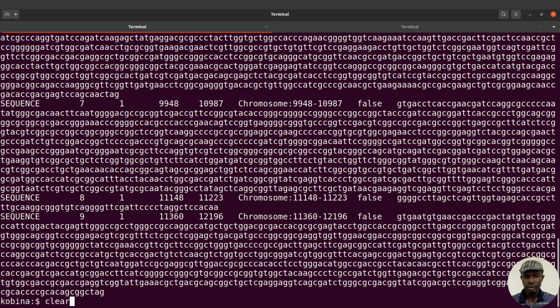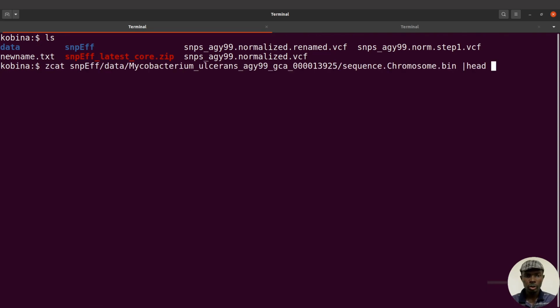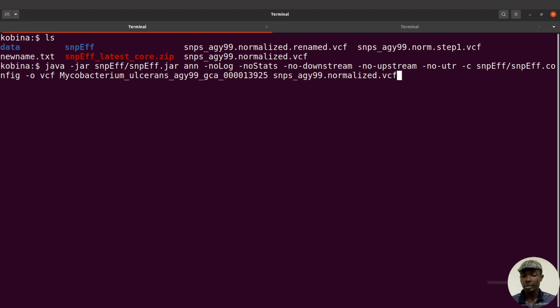Okay, so I'll clear the screen. I'll just do an ls just to check my stuff again, and then I'll recall that command, the one we used. If you want to recall a command, just use the up arrow on your keyboard and press it until you get to the command. So you don't need to type everything again. So we are going to rerun, but this time we have to change the inputs because we now have this one here. This is what we are going to use. So I'll need to clear this one here and then supply it with snips normalize.renamed.vcf. So this becomes our new input. So let's execute this command.